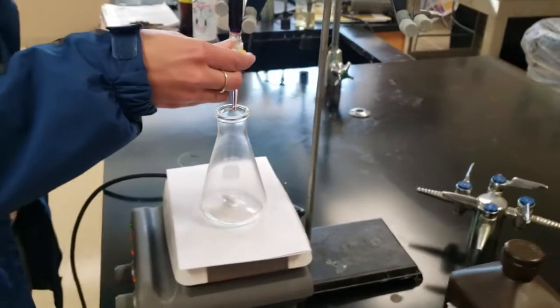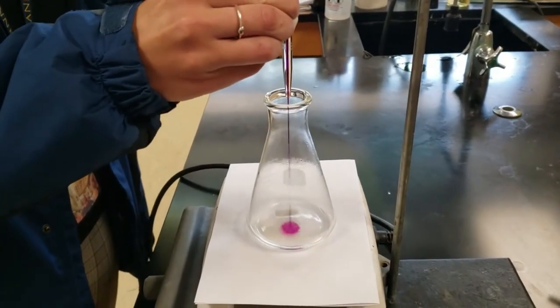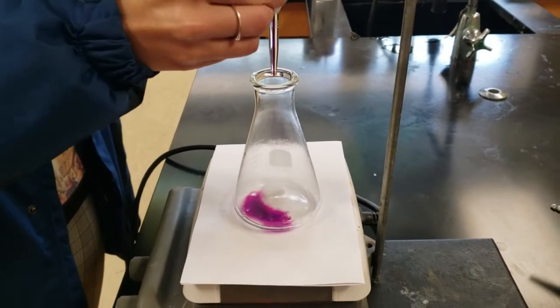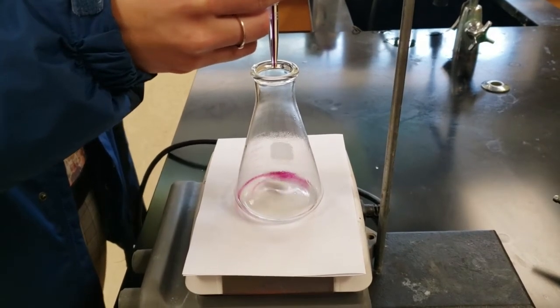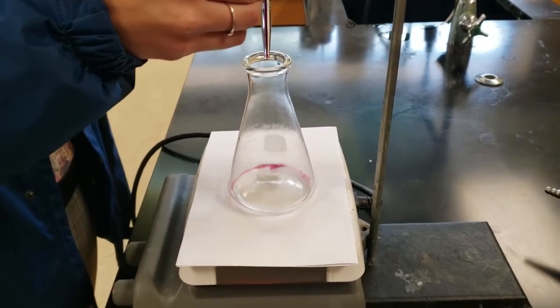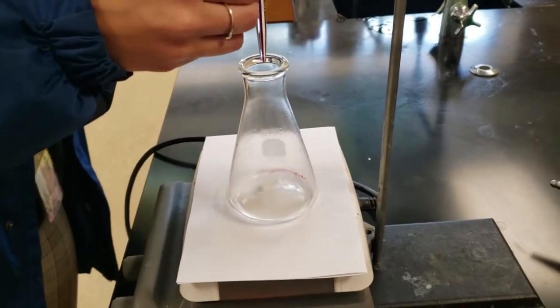Now that we have the peroxide and the acid heated up and the stir bar in there, we're going to start adding the potassium permanganate to it. Notice the color goes away, which means the permanganate reacted. As long as it keeps reacting, the color will go away.